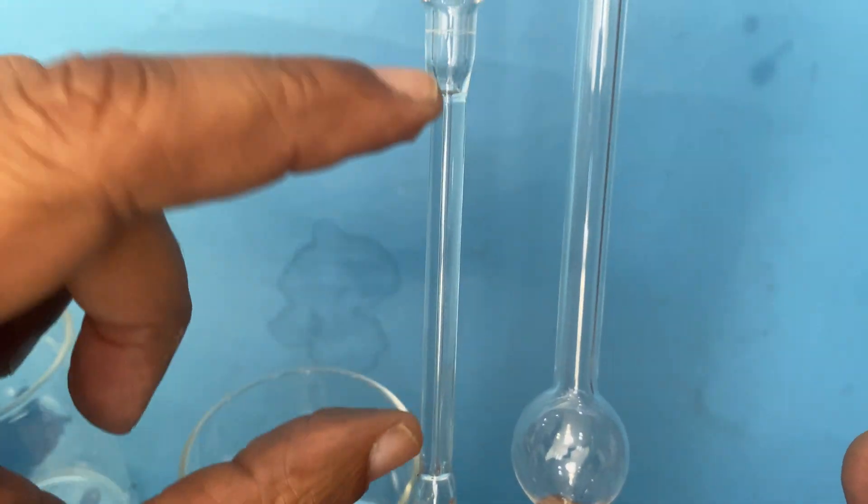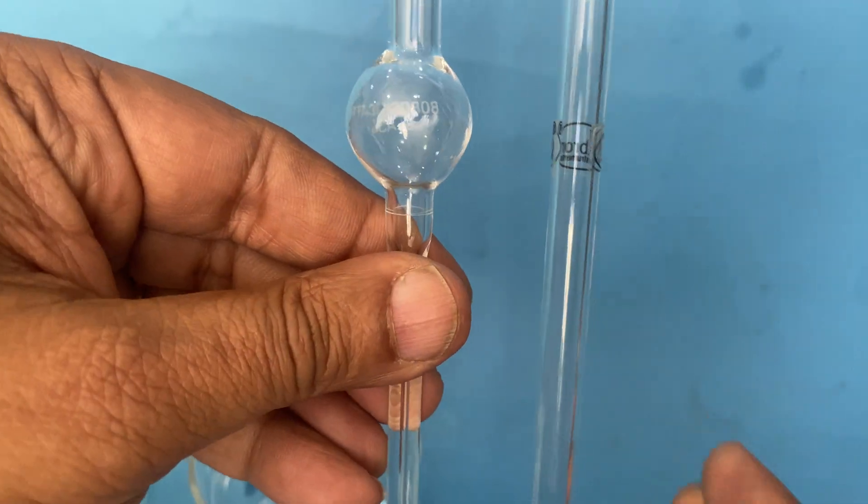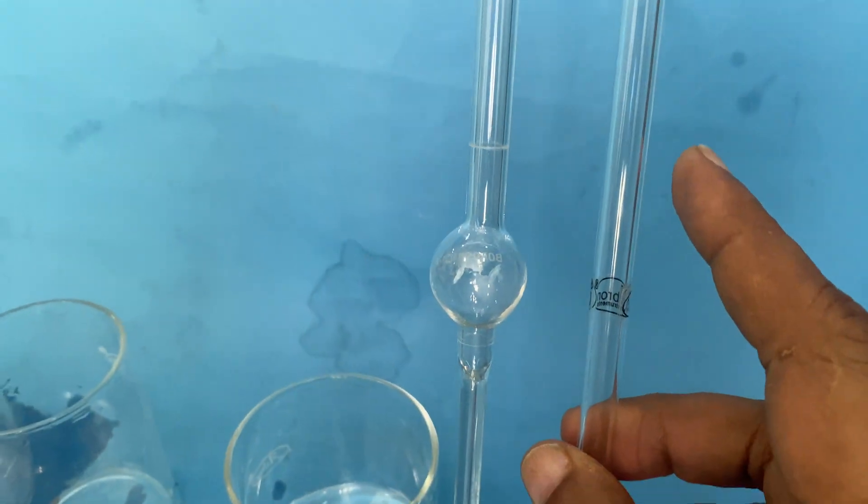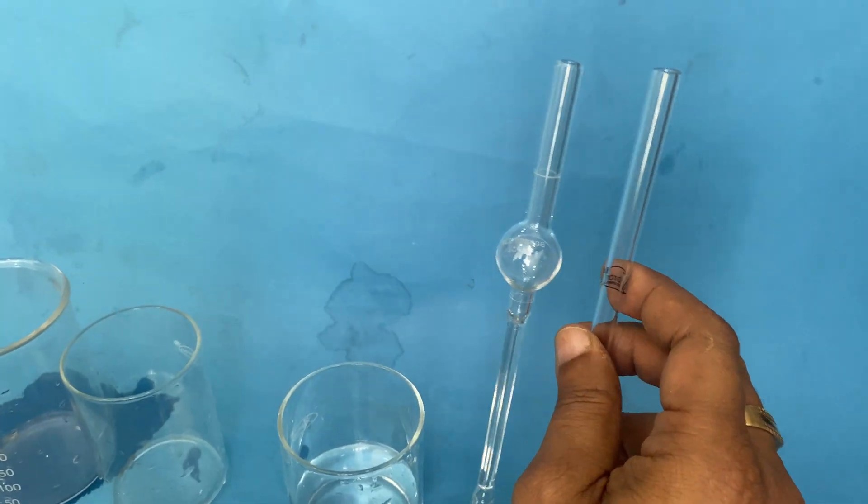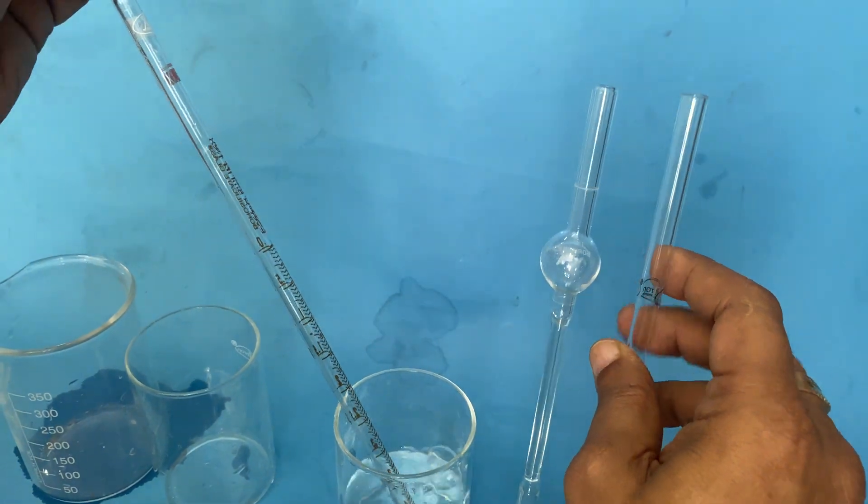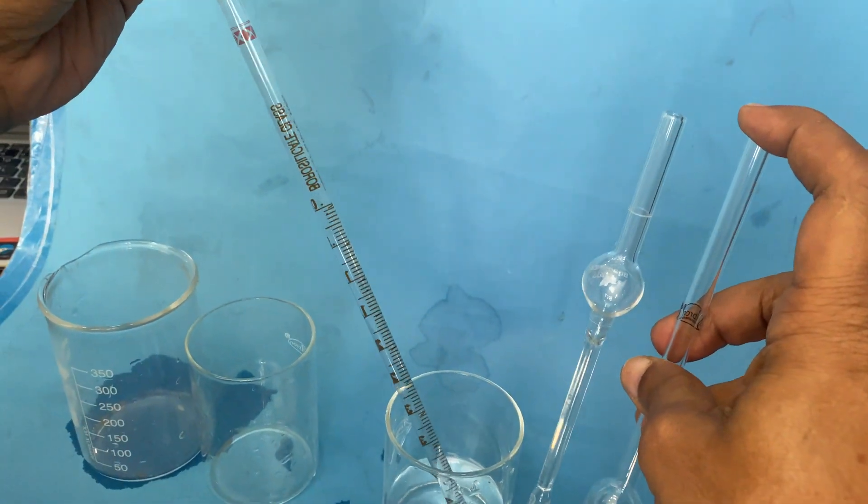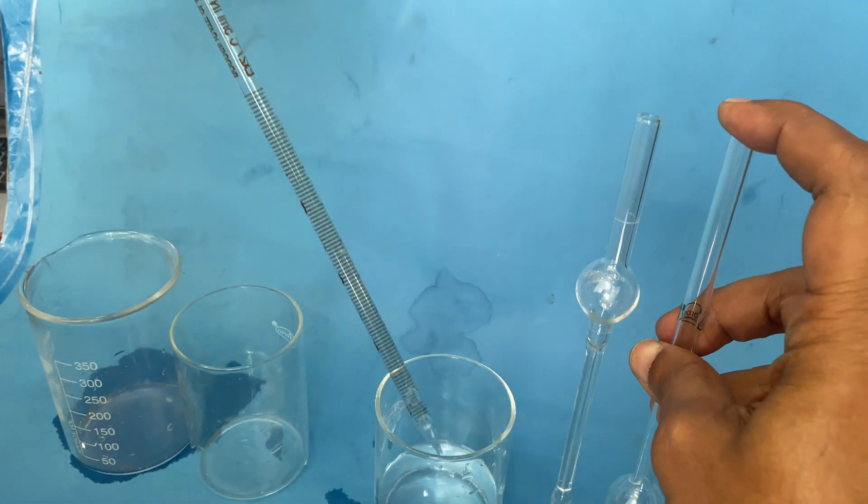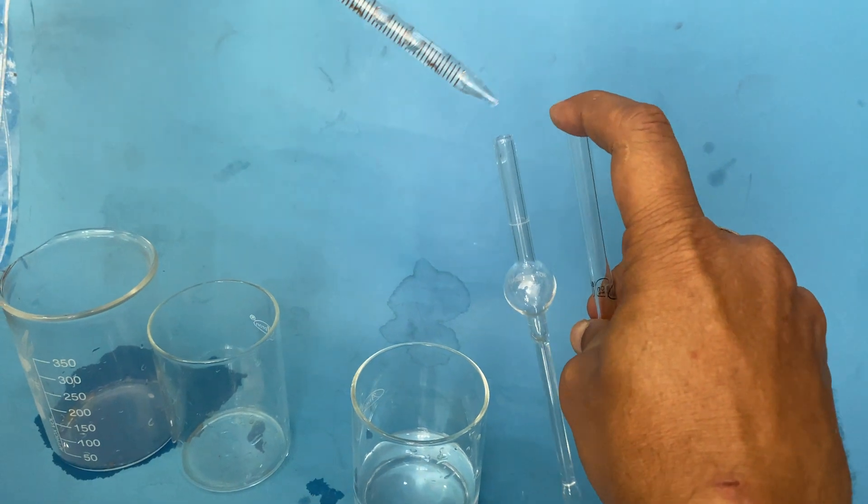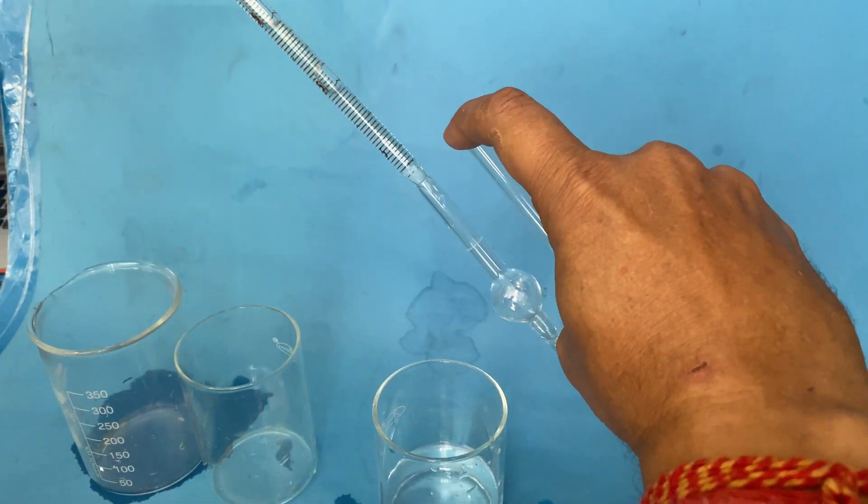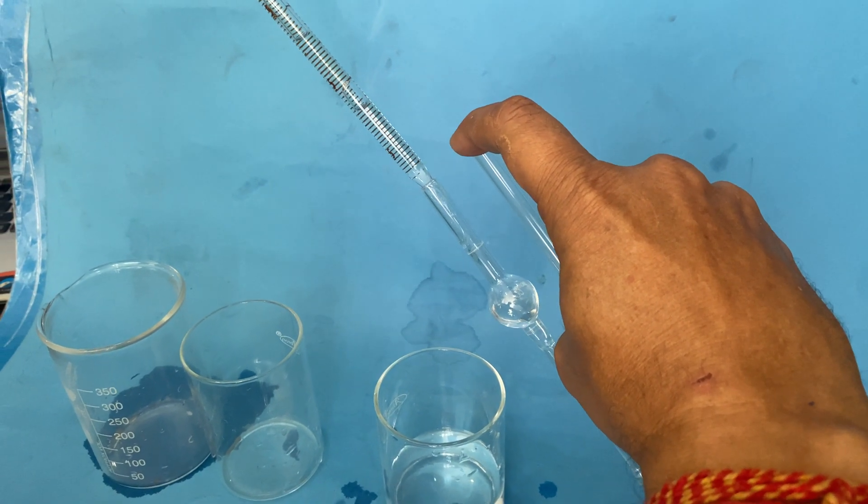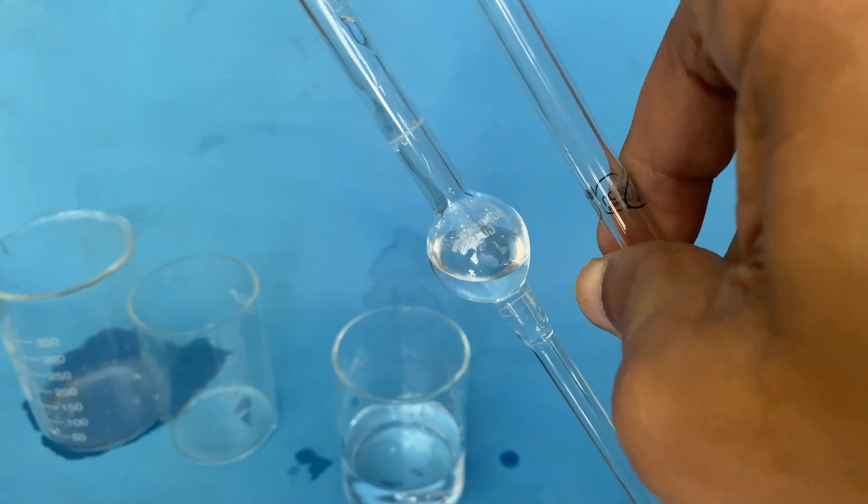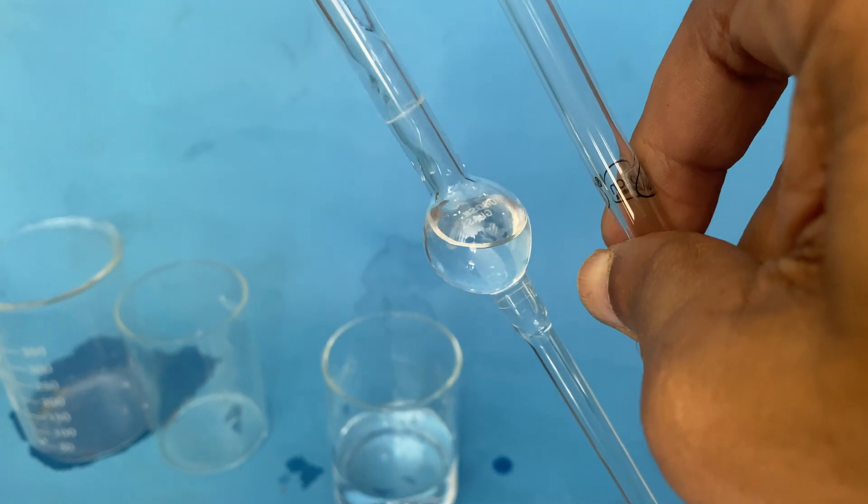This has a capillary here till the bottom at a specific length. First, we put in any testing chemical. I'm just doing it with water. I close one end of it with my finger, and then at an angle I put the water in.